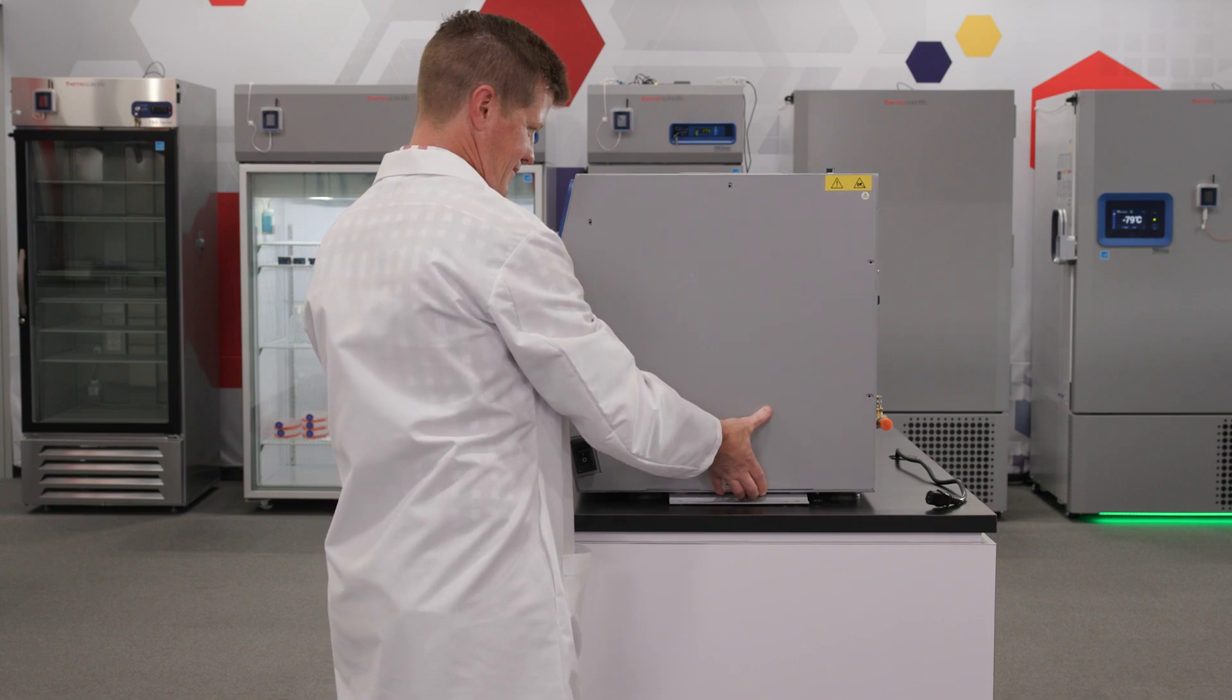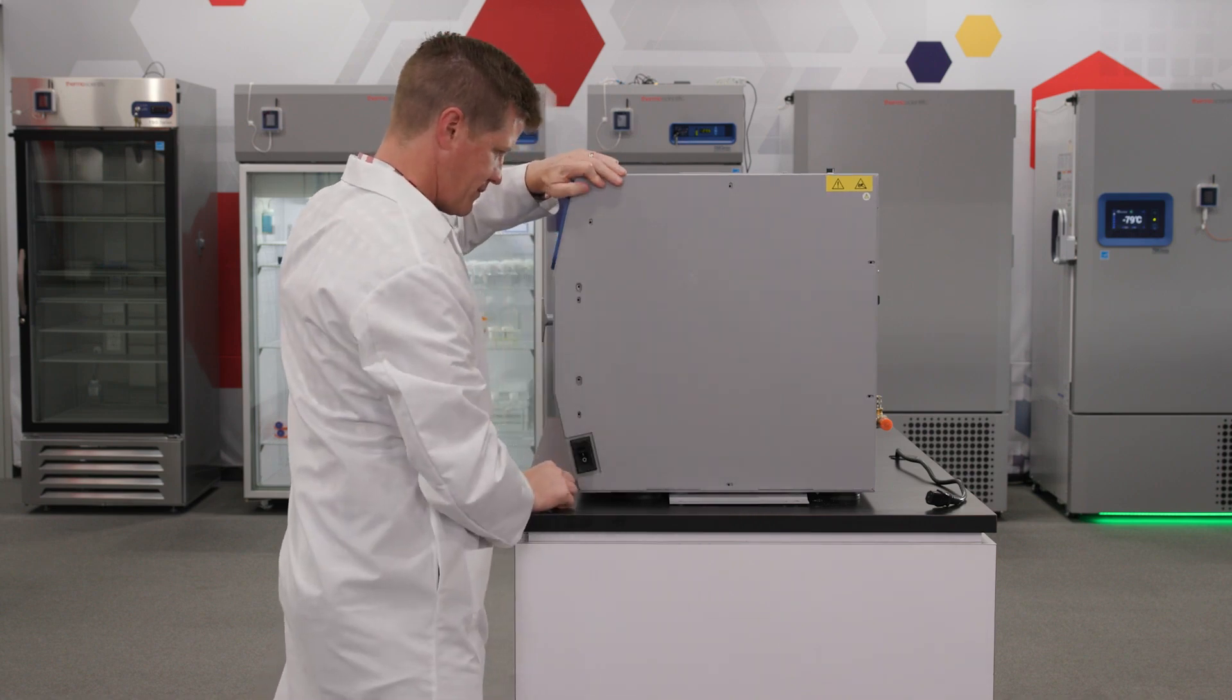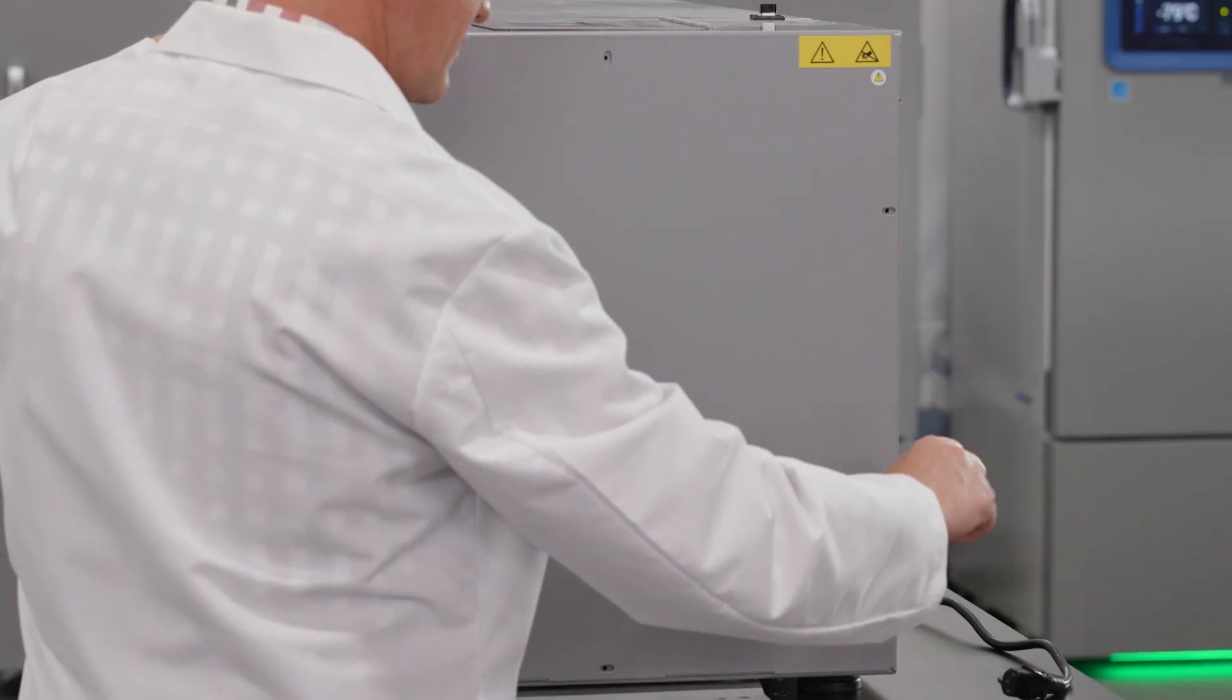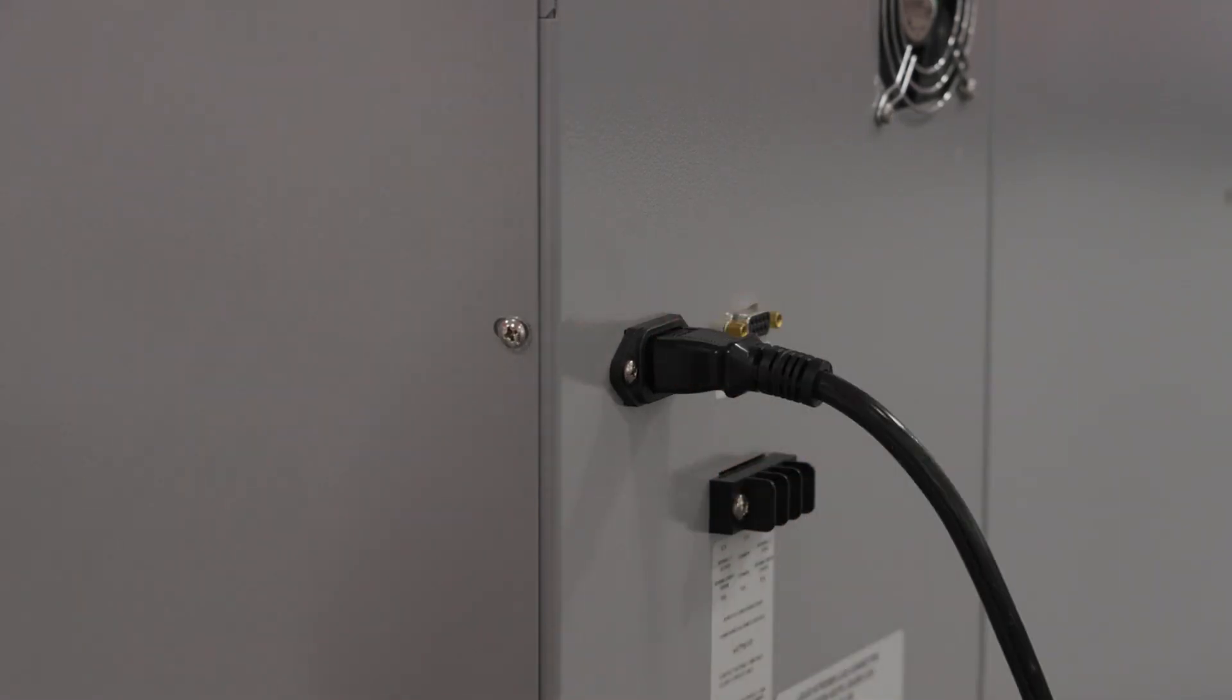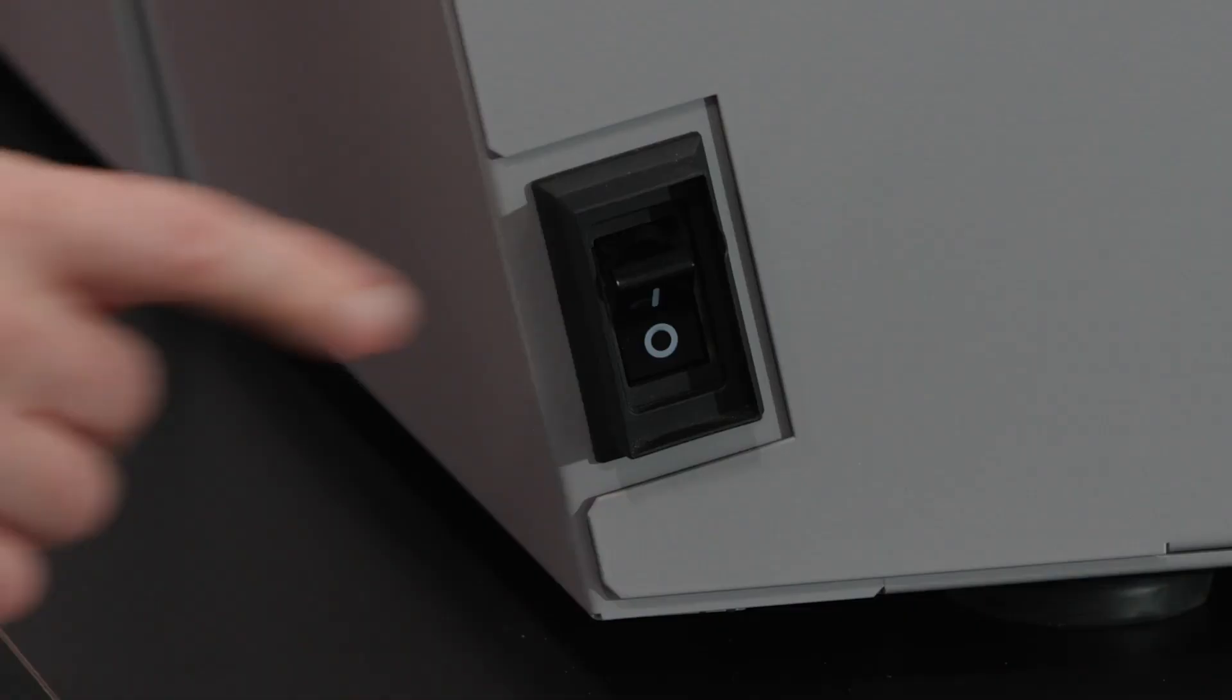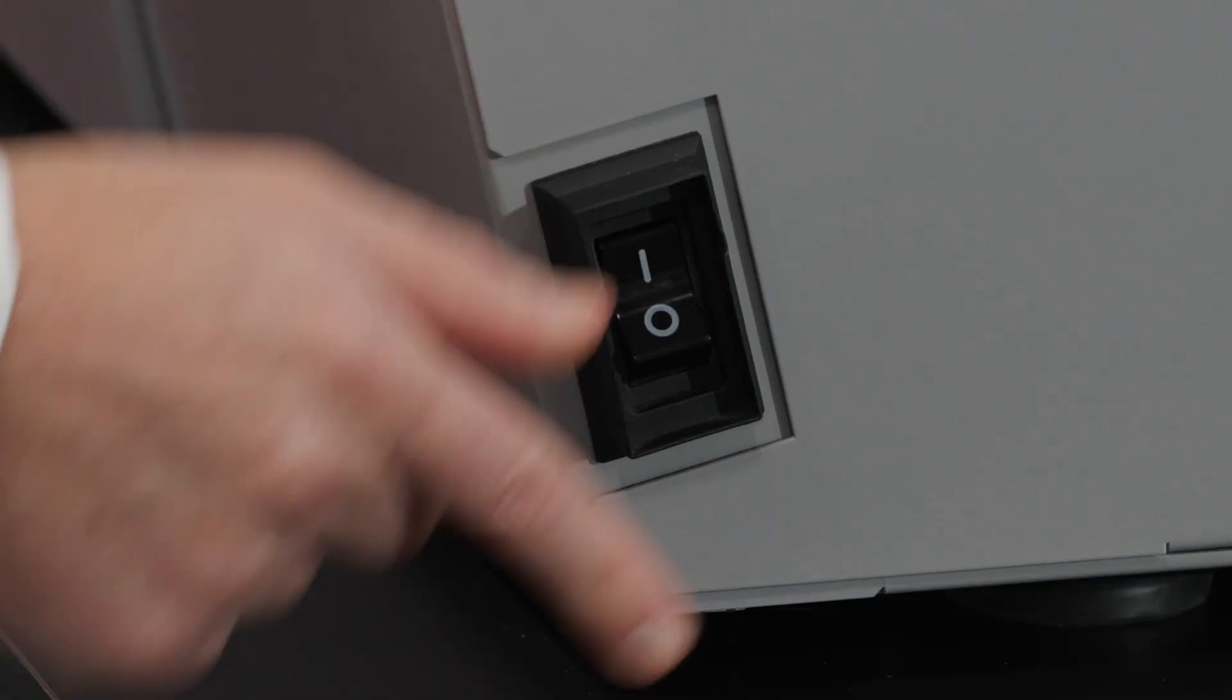the service panel can be replaced by putting the panel back into position and replacing the screws around the periphery of the panel. After the panel has been securely refastened, the power is ready to be turned back on and the unit can go back into routine use.